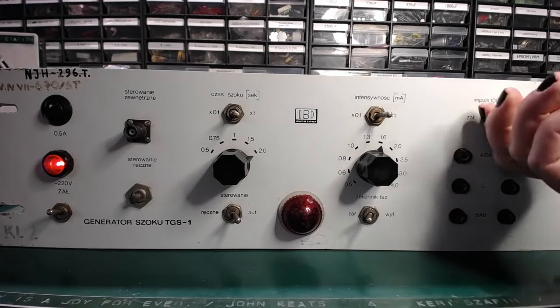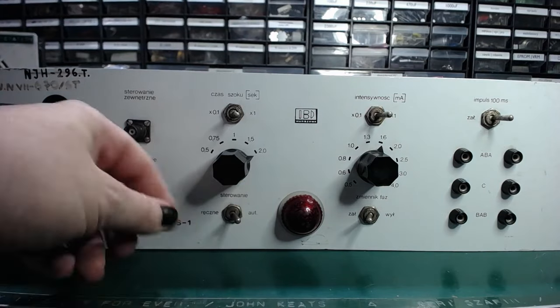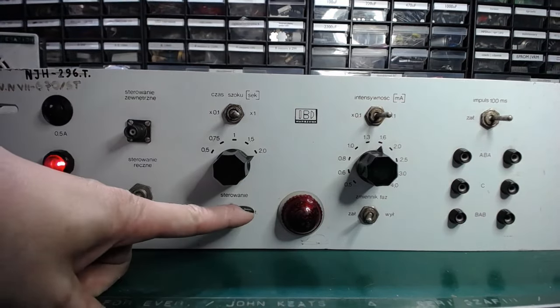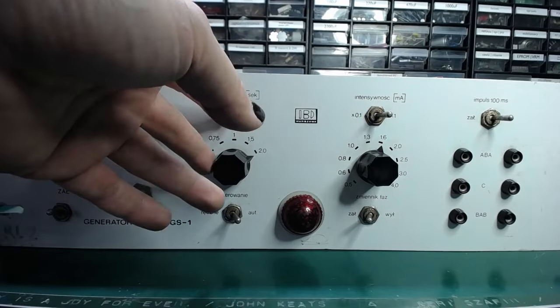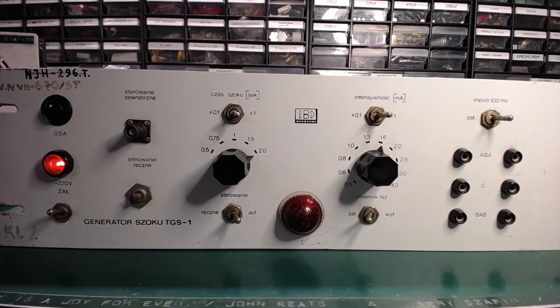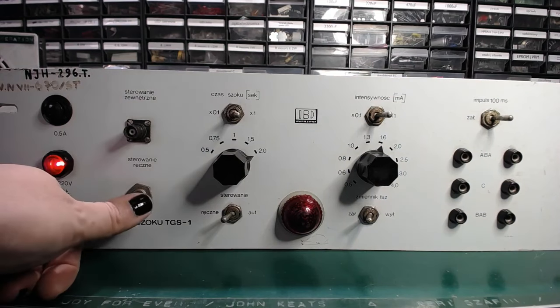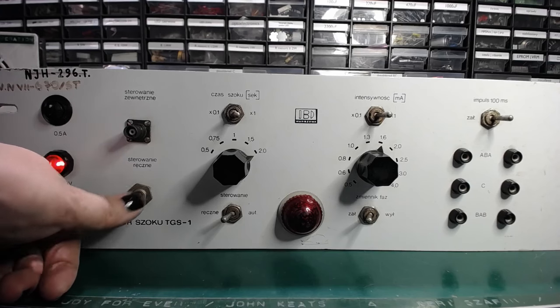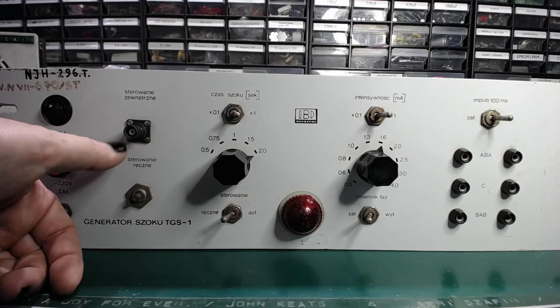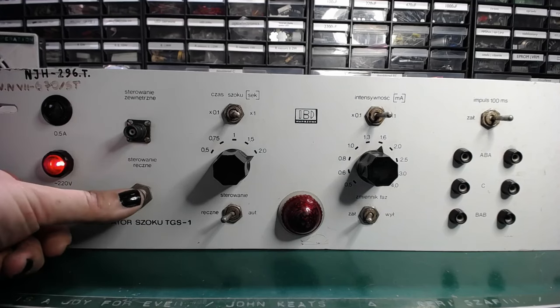There is one more switch. No, there are two more switches. One of them is for the automatic or manual control. The automatic control uses the timer and the time constant we set here for setting the shock duration, but in the manual mode we decide how long the shock is delivered by pressing or holding the control input pulled to ground for as long as we want.